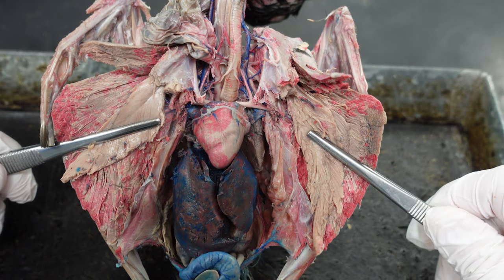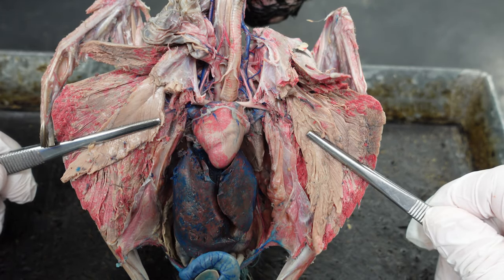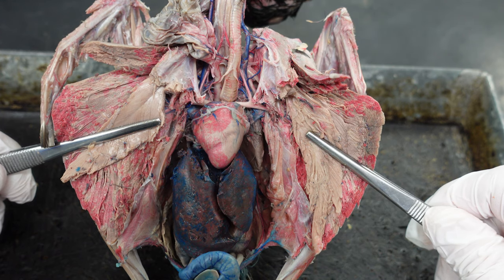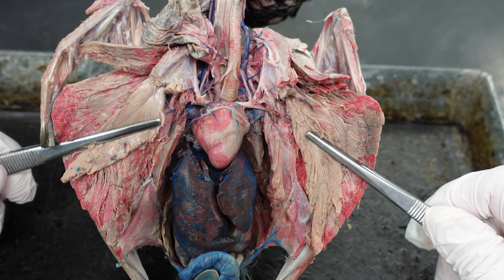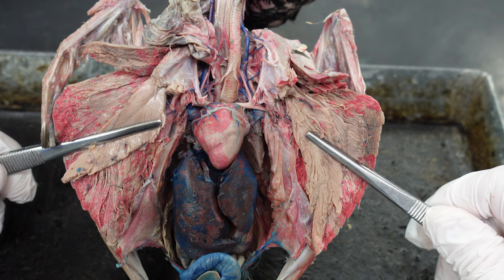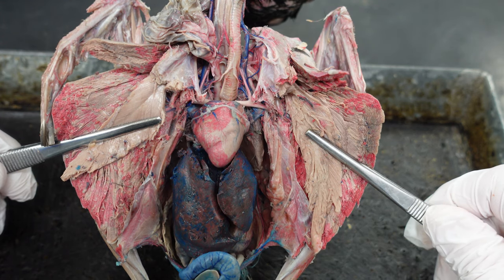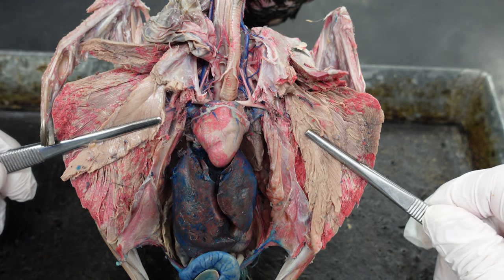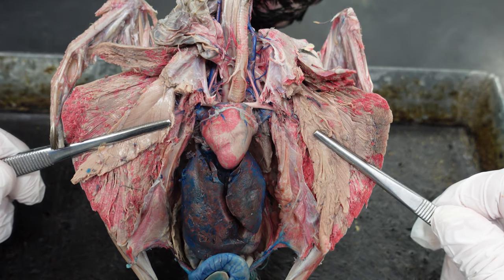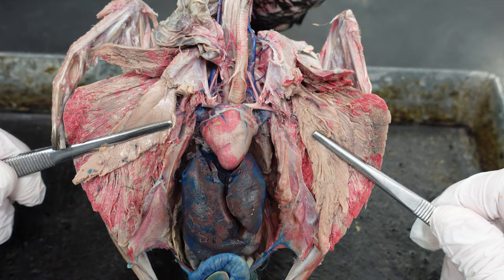Hi everyone. This is going to be a walkthrough of a pigeon with particularly nicely filled veins, so we can see those venous structures much more easily than on the original demo pigeon. This is one of the student's pigeons and they graciously allowed us to do this. That's a lie.